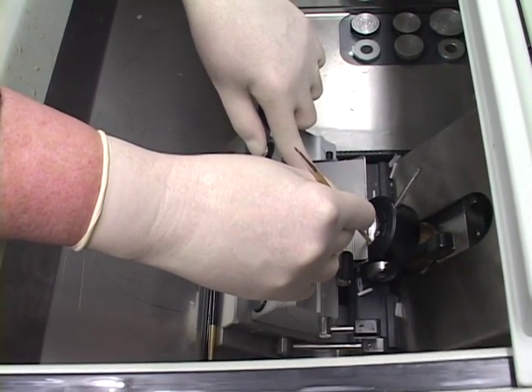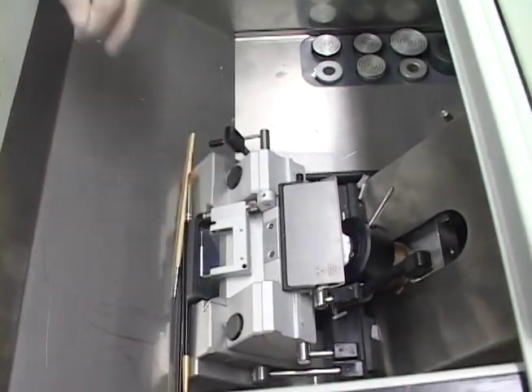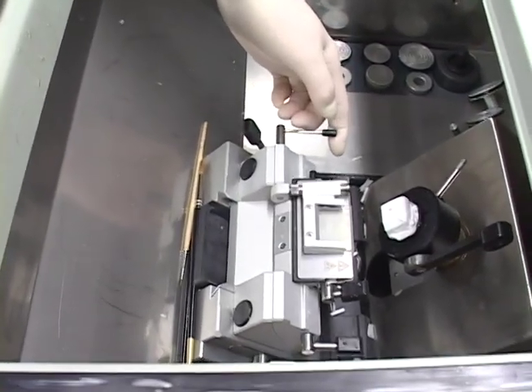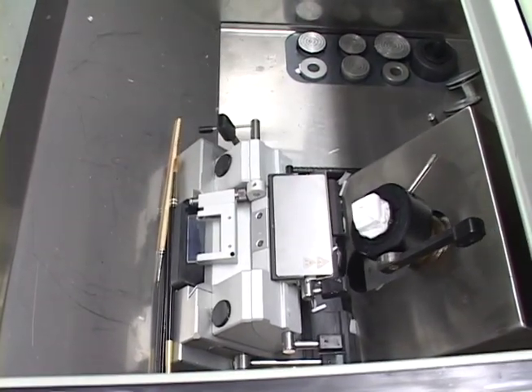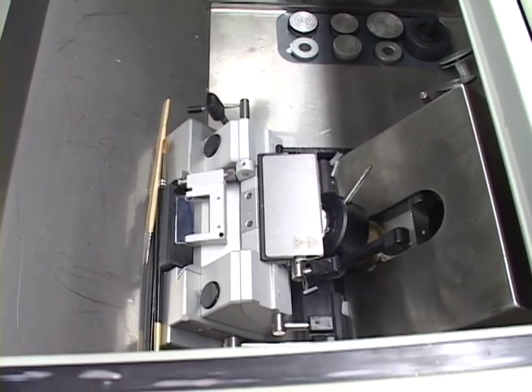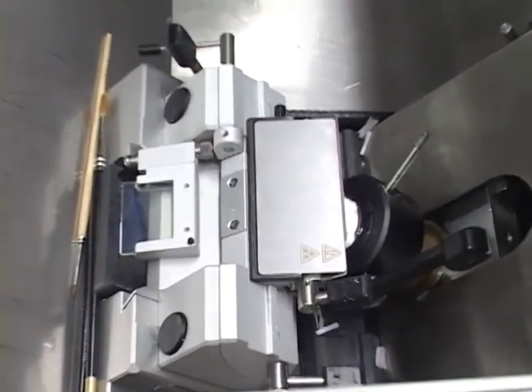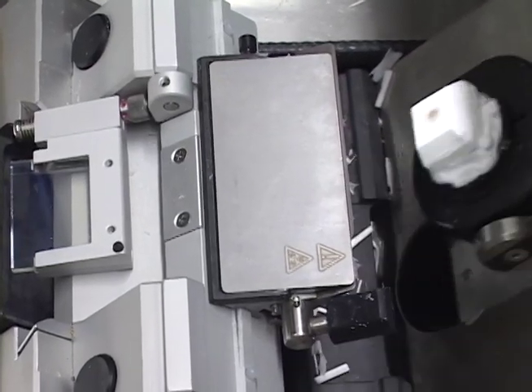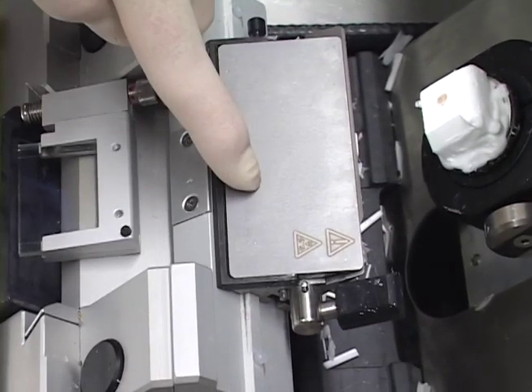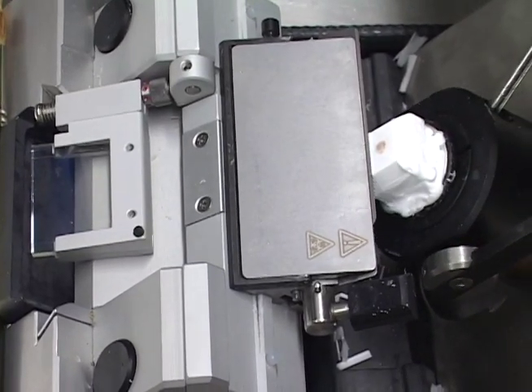The other thing you can do — and I can see my blade is going down underneath, which does happen — is this lever will release and let you slide it this way or that way. The only problem is the design of this knife holder means if you start getting towards this edge, this little lever is in your way. Another reason I tend not to slide the whole knife plate is because it readjusts the blade slightly, and then you really should back it off to make sure you don't come and gouge your tissue. So I actually prefer moving the blade itself.